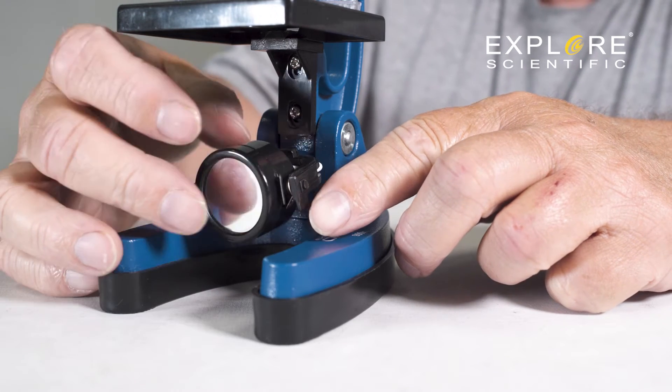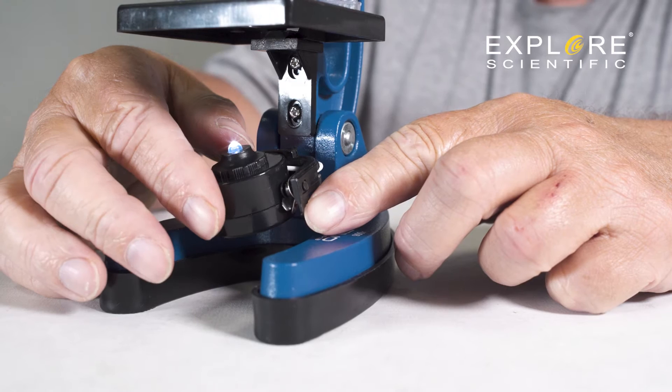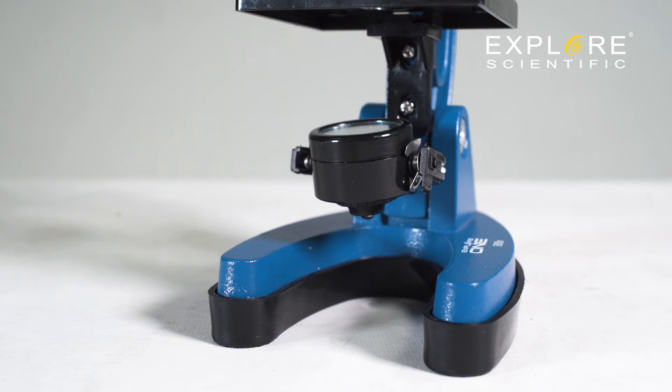Leaving the light on for extended durations will eventually drain the batteries. It's good practice to keep the ambient mirror facing up when you're finished using the microscope.